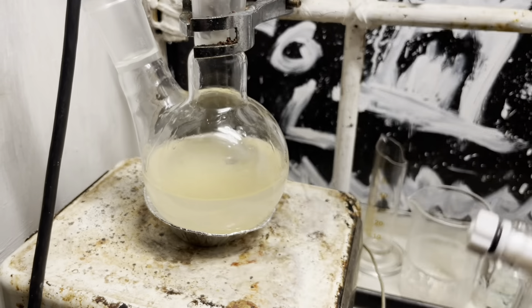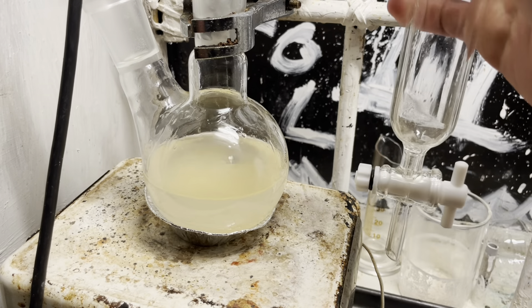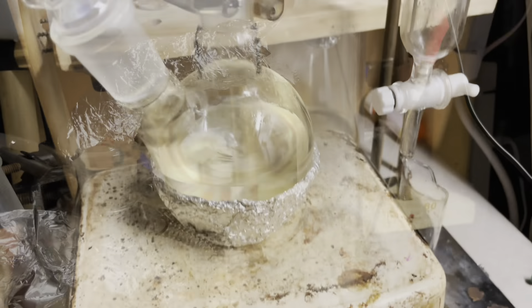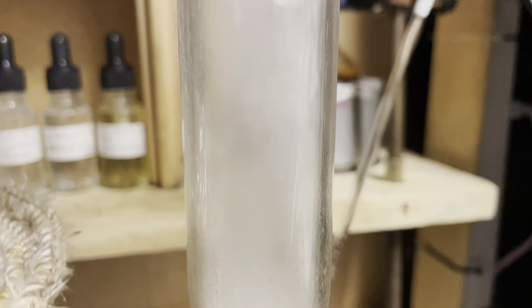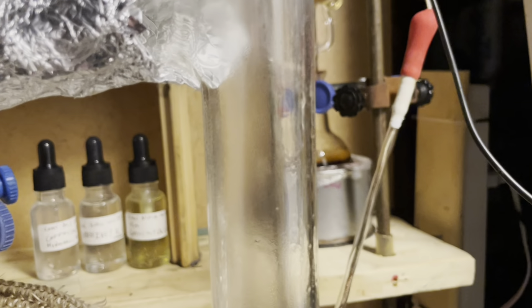20 milliliters of sulfuric acid added for the actual sulfonation of toluene, and it went yellow because yellow chemistry. We're going to add this weird Dean-Stark apparatus on top - it's a very weird one - and the reflux condenser, and we bring this up to a boil. Strong stirring in the toluene-sulfuric acid mixture is needed; otherwise it won't sulfonate properly because it's not being mixed very thoroughly.